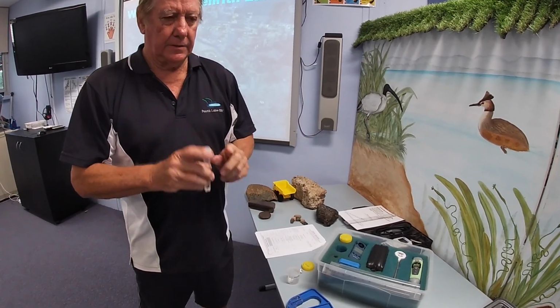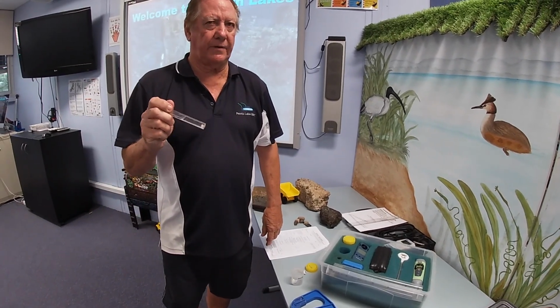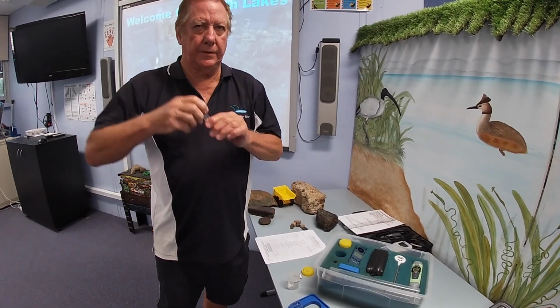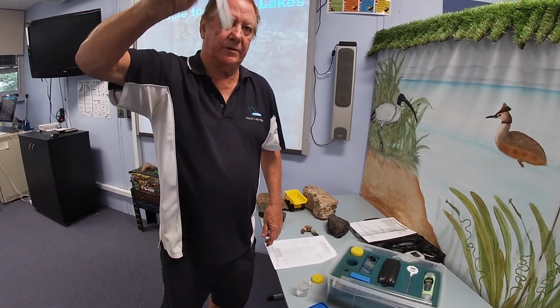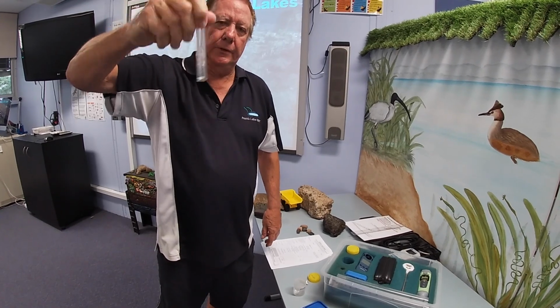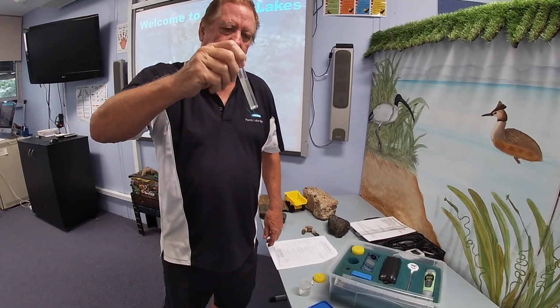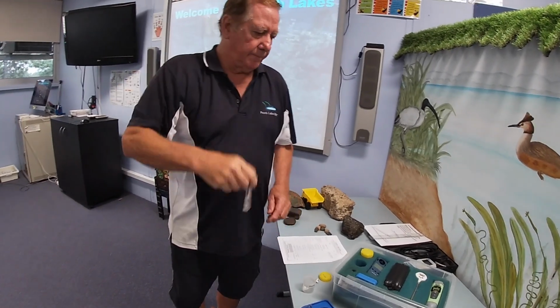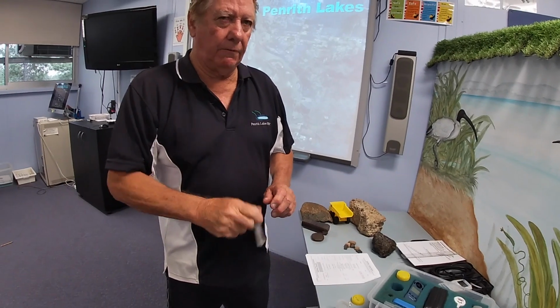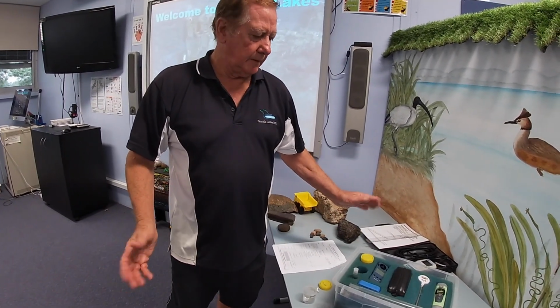Next step, simply shake it. We need to shake this until it dissolves. This will take forever. So what we need to do here is shake, shake, shake. It is not going to dissolve like sugar into a cup of tea, but it'll take a long, long time. So what we're going to do is get that dissolved, and once we've dissolved it, we put it back in here for 5 minutes. We just simply wait.